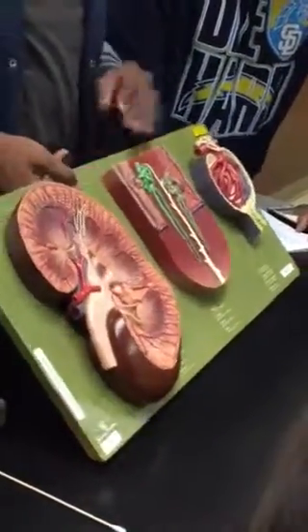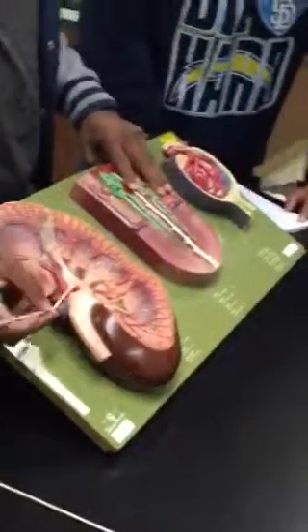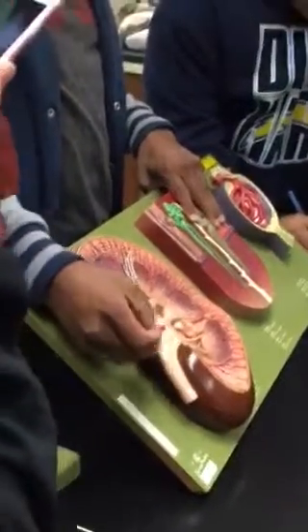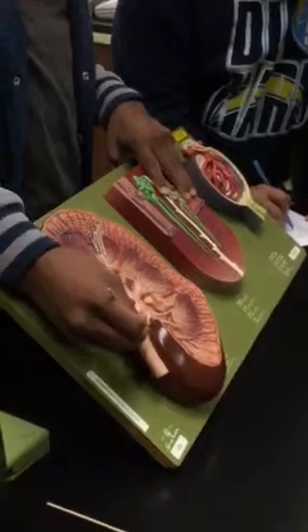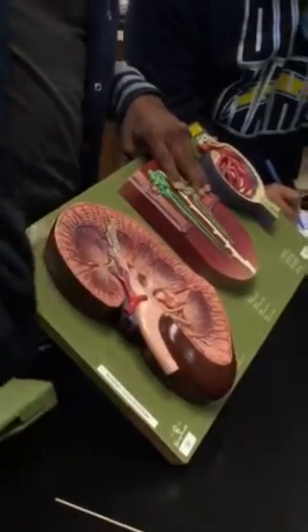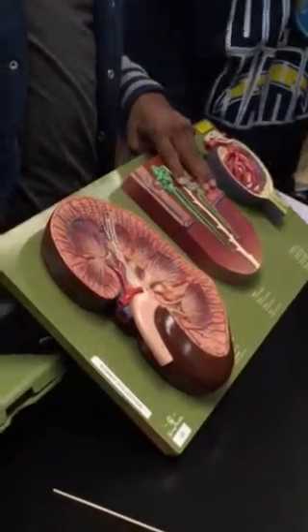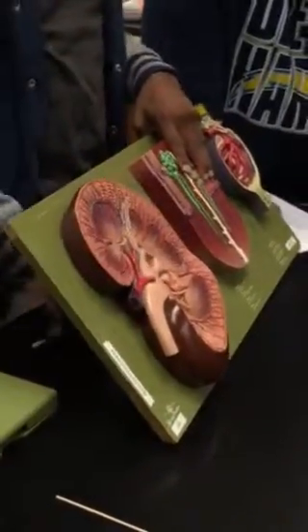Okay. So starting on the list, the first word, the hilus. The hilus, you see the tan, the red, and the blue? The tan, the red, and the blue, all together, this area is the hilus, with all three of those colors. Number 4. So all three colors together, and we'll learn the names of each part. You can see the hilus, or even over here, you notice the tan, the red, and blue, the whole bundle. The bundle of those three, that's the hilus.